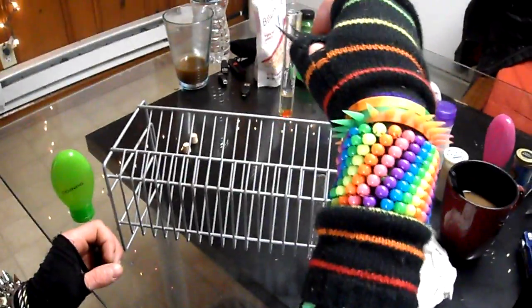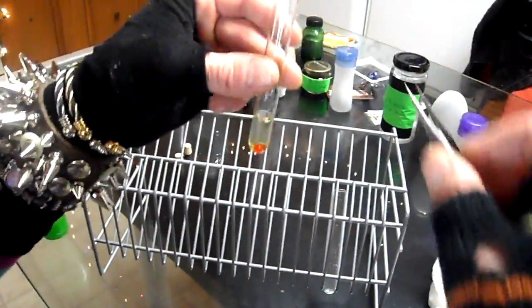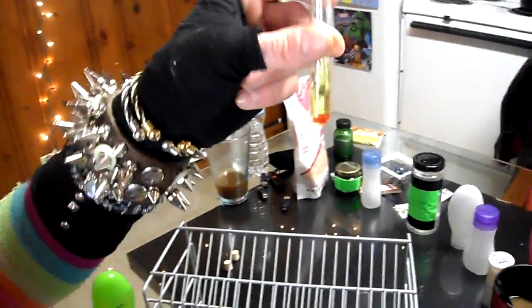Yeah. Alright. So what we're going to do is, you're going to take the tongs. You're going to pick up the test tube, and I'm just going to swirl it around a little bit. I can touch the outside. Just want to make sure it gets dissolved in there, so you can see that it's a good solution. We got some cobalt chloride here dissolving into the deionized water.